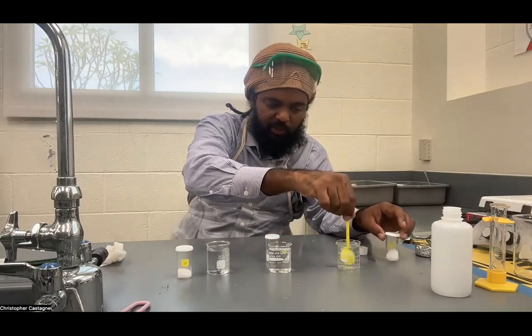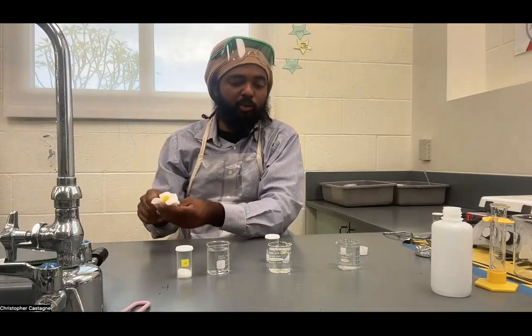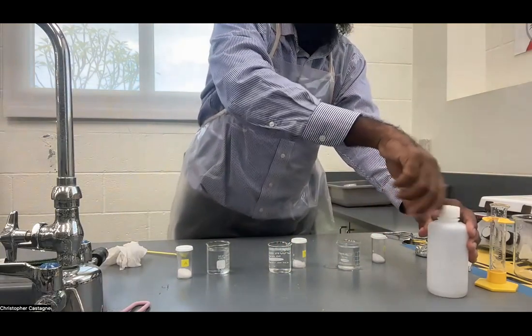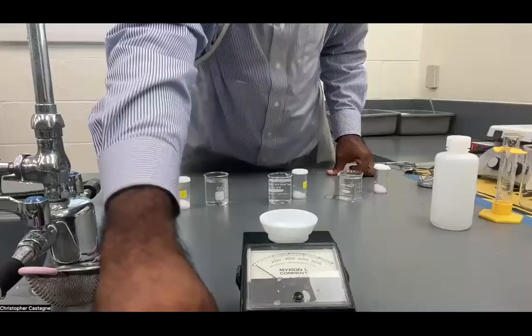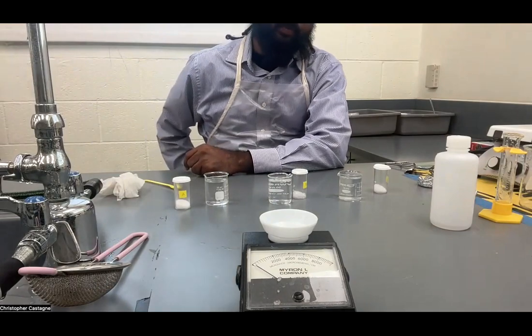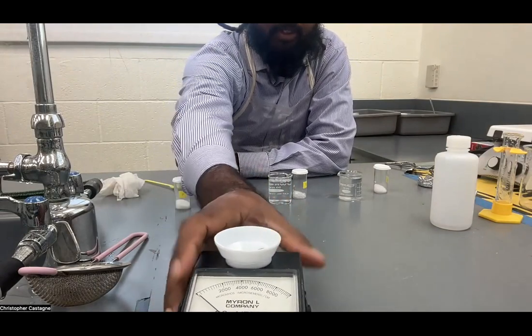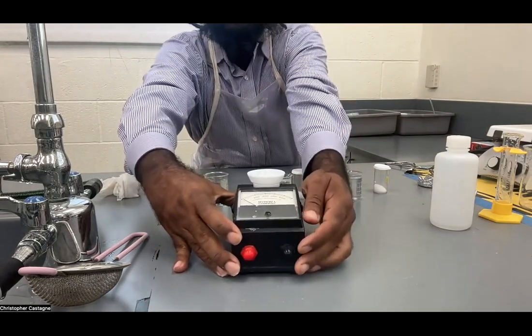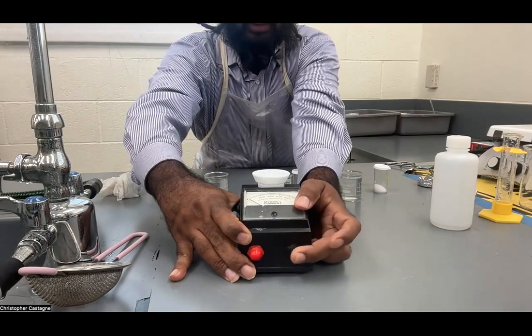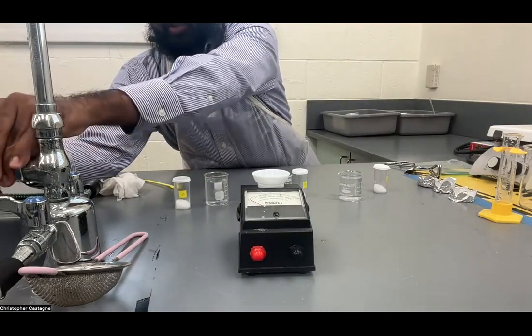It's very important that you wipe your spoon in between making your solutions, otherwise you can cross-contaminate and get incorrect results, especially for this last test. For the conductivity meter, we call it a 0 to 10 scale. There are two buttons: the red button tests to see if the meter is actually working, and the black button measures the conductivity. Let's check by putting some plain water in — water should not have a detectable level of conductivity. With the black button, there's no deflection on the needle.